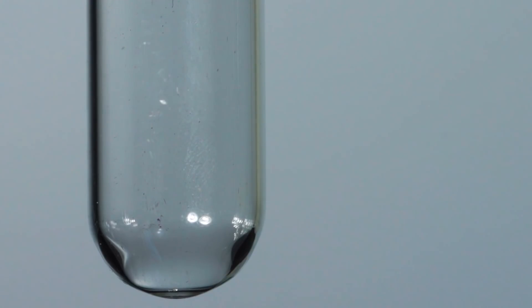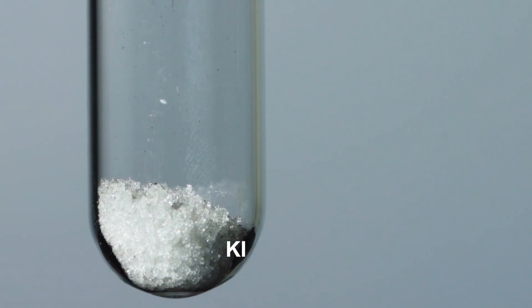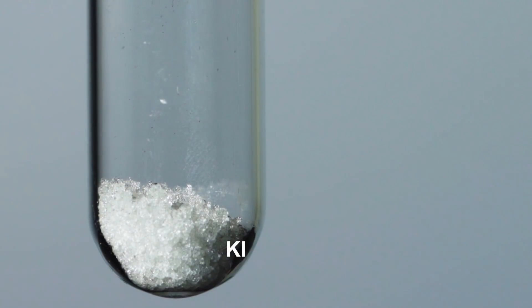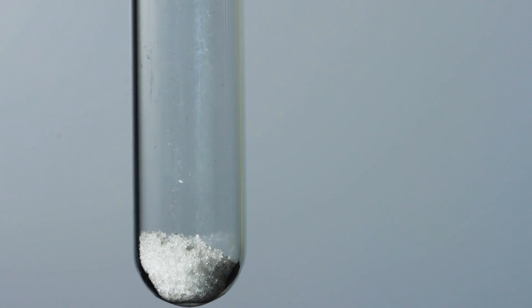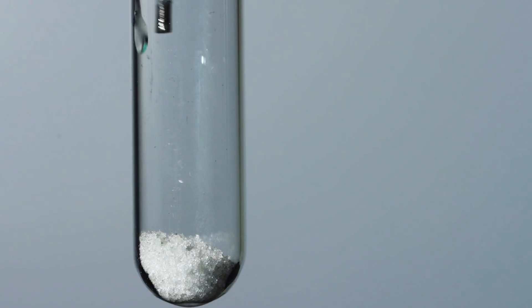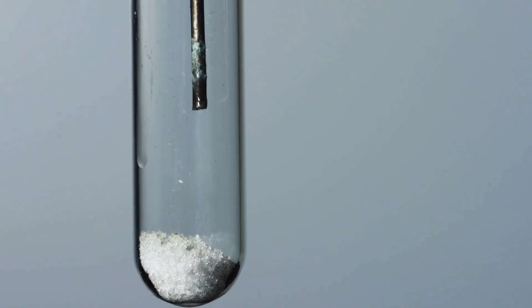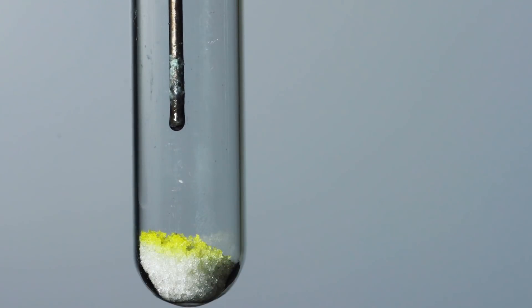Potassium iodide is very sensitive to germanium tetrachloride vapors. You can see potassium iodide turn yellow even before it touches a drop of the reagent. This is the reaction with the formation of another germanium halide — germanium tetraiodide.